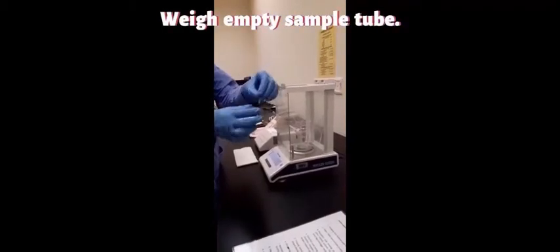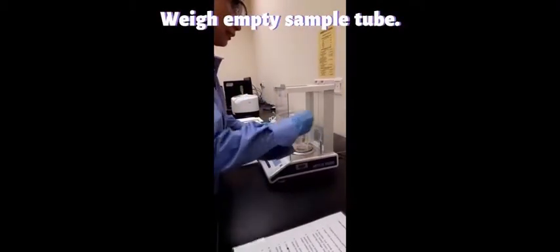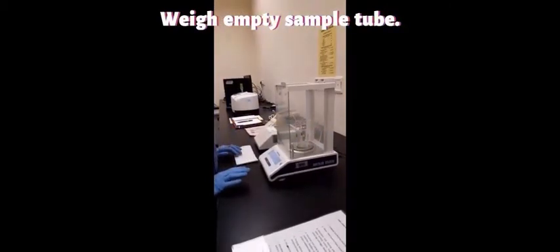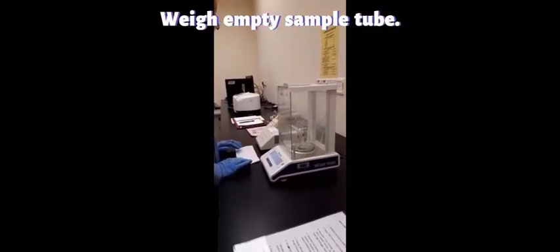Today I'm going to demonstrate how to use the equipment. First of all, what you need to do is get the weight of the empty sample tube. This is how the sample tube looks. So get the weight first: 0.8342 grams.